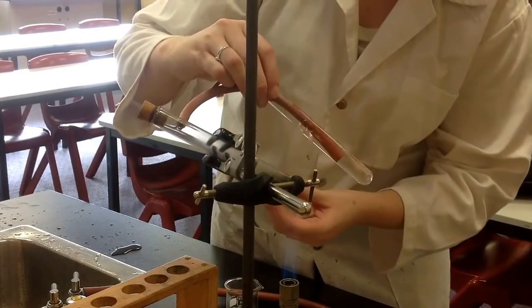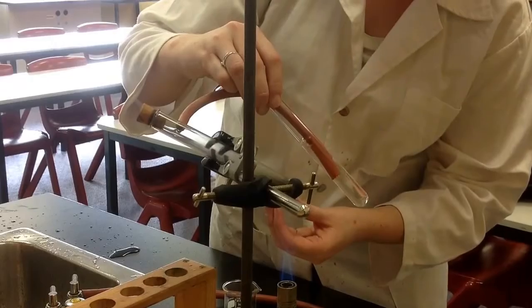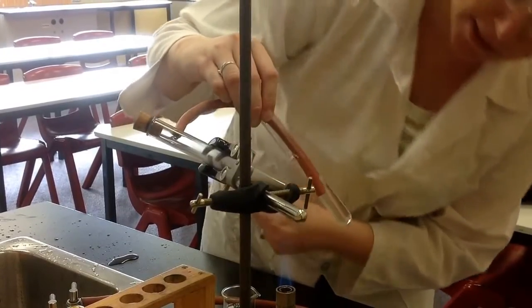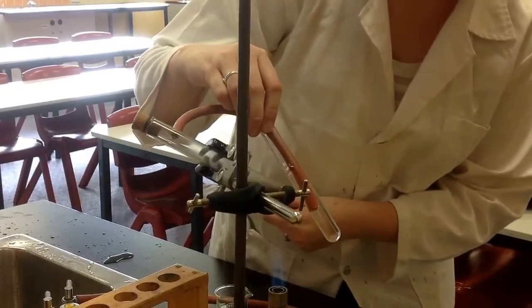So if you can see in that, there is bubbling occurring here. At the same time the green color is disappearing and I'm getting a black powder.